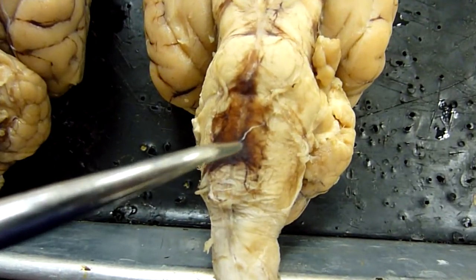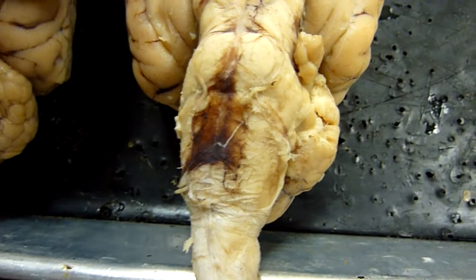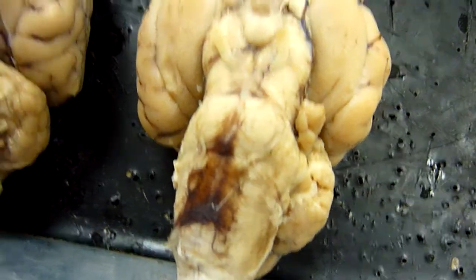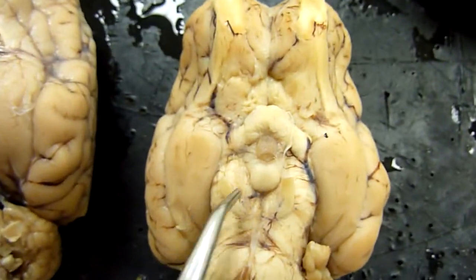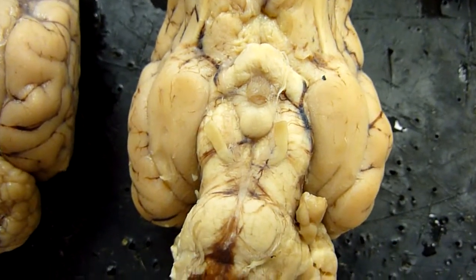And then the ventral fissure is the line, which you can't really see — it goes all the way down.